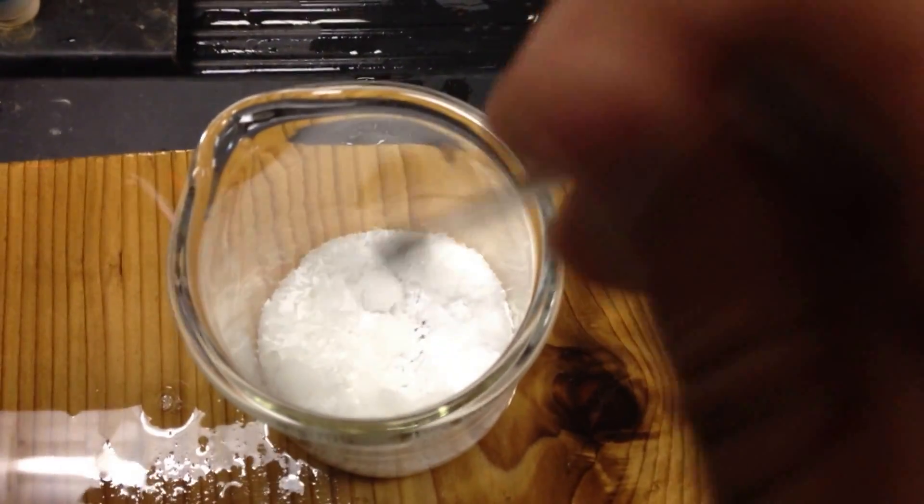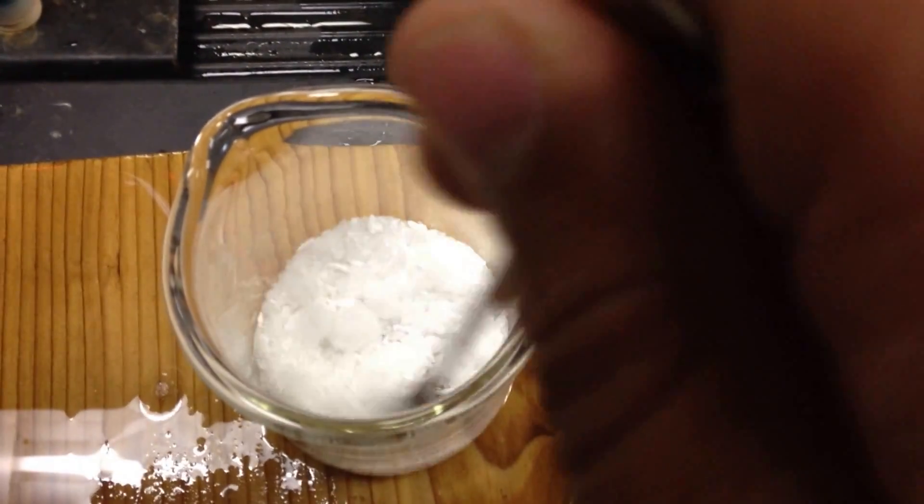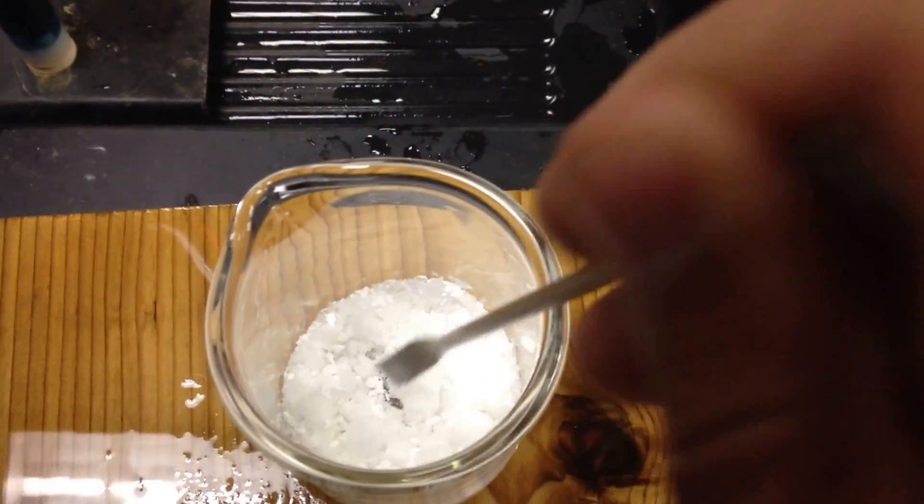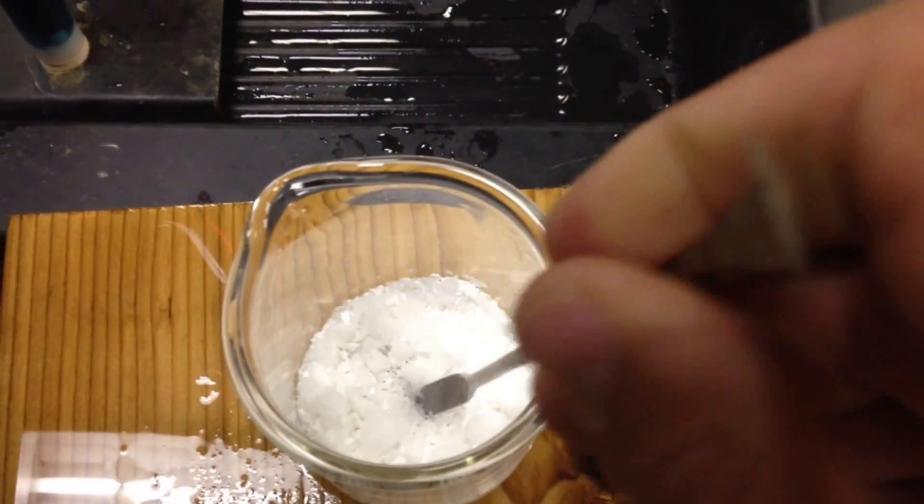I'm going to stir. Of course, we should see some changes because now I have two different chemicals. Do you see anything? It's blue. Um, close.